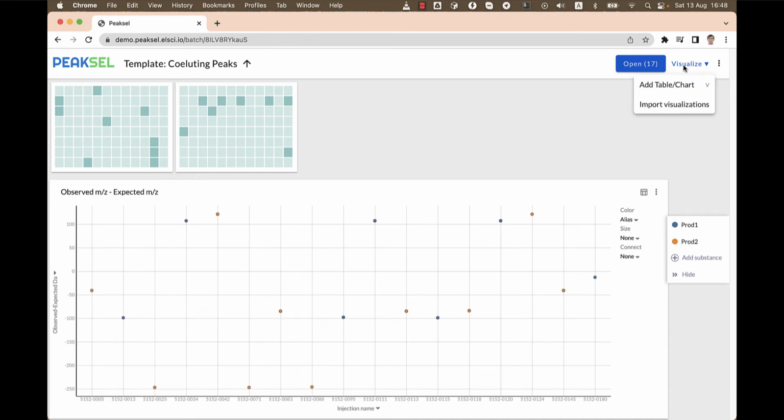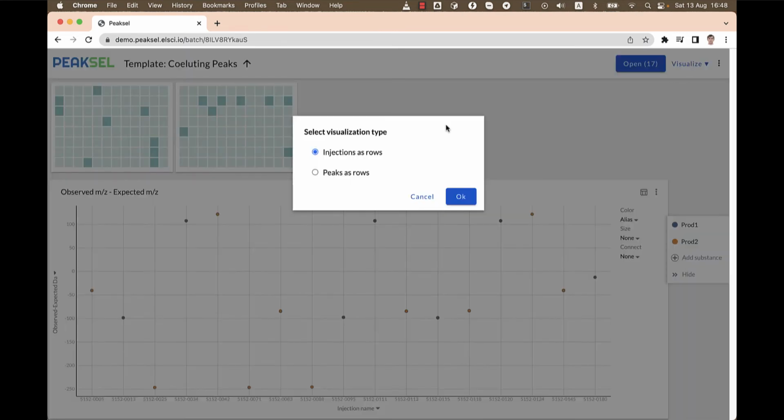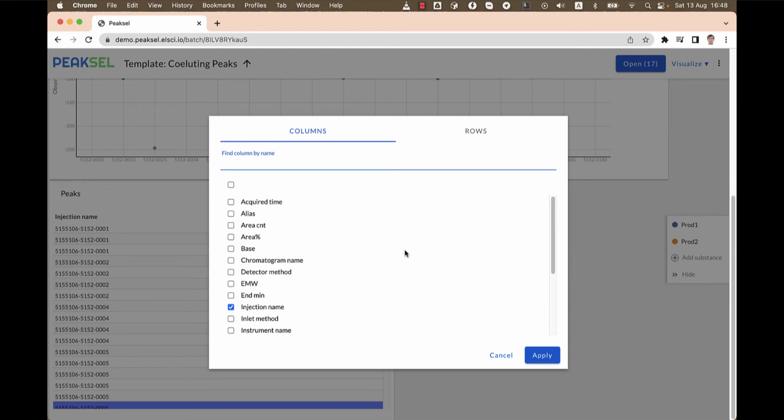So first of all, we go to Visualize menu item or simply press V as a shortcut. And here we can create a table with injections as rows or peaks as rows. In this case, I choose peaks as rows because I'm mostly concerned with the peaks and their health. Now we can select which columns to add. I'll leave injection name checked, but I'm mostly interested in exact molecular weight of our peaks and their base, which for mass spec is a BPM.